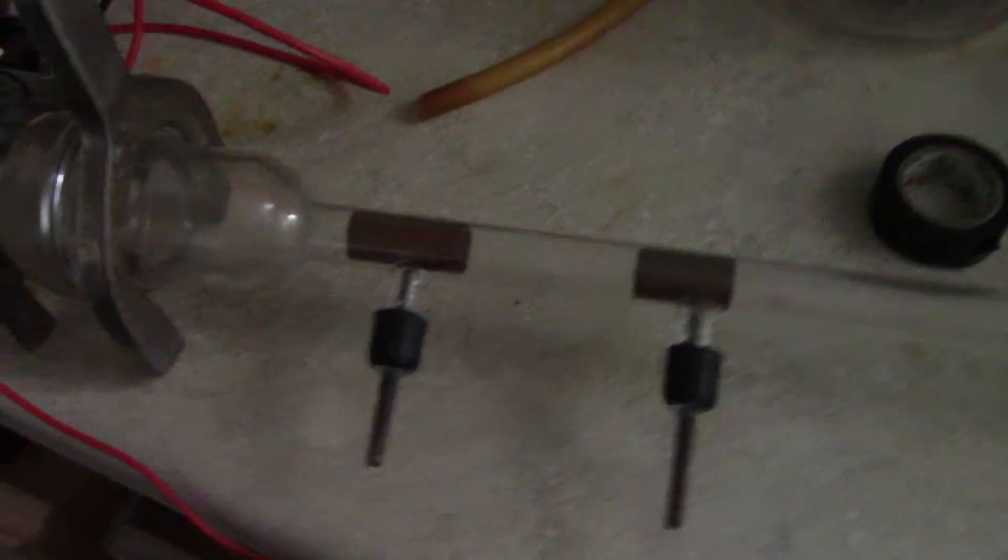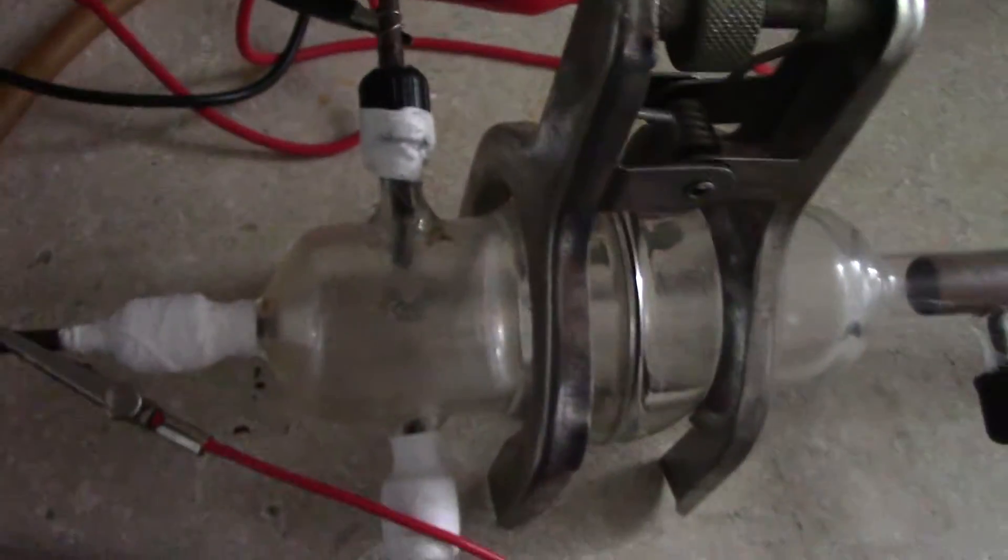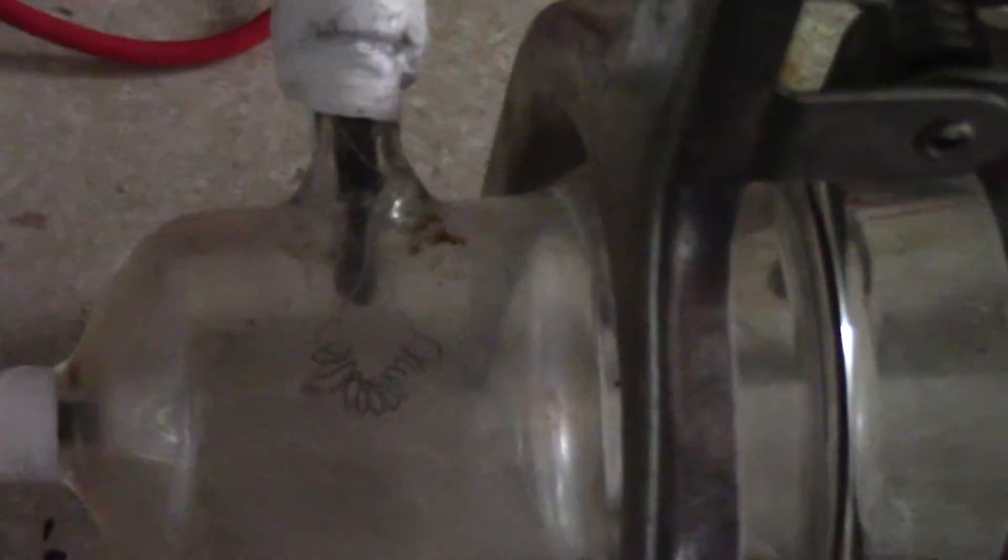There's some high voltage connected here. I can put a focusing ring and the filament right here, which I can control with this power supply.